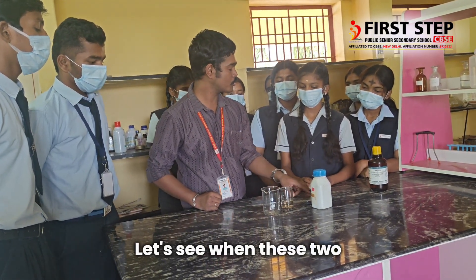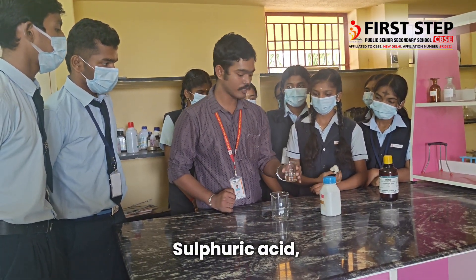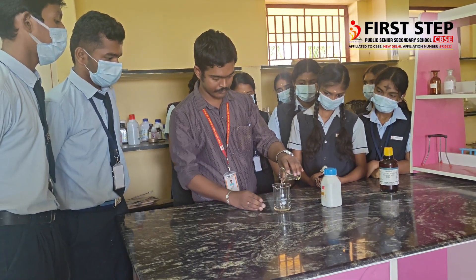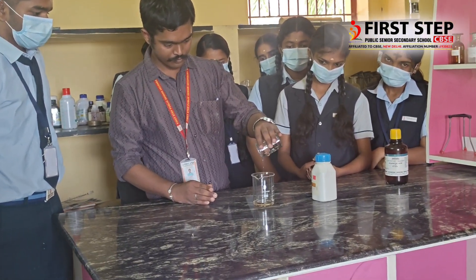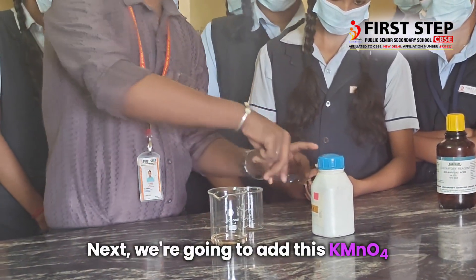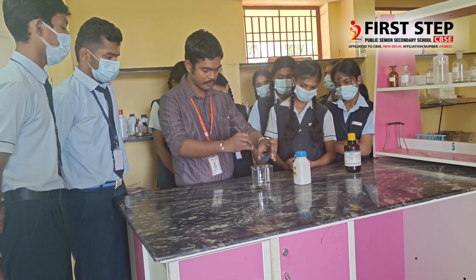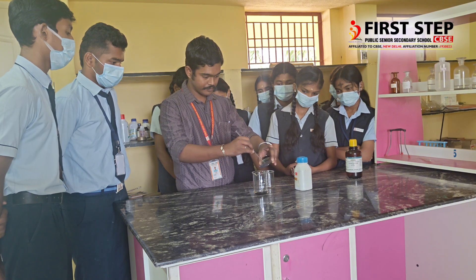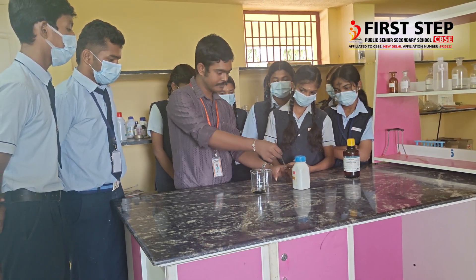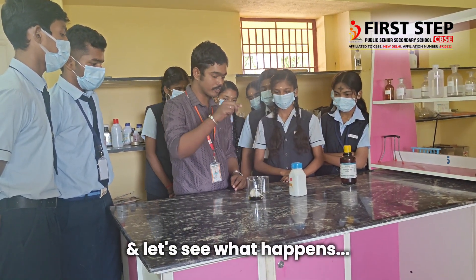Let's see what these two reagents together produce. This is concentrated sulfuric acid. We are going to add concentrated sulfuric acid. Next, we are going to add a portion of KMnO₄ powder into this liquid acid. Now I am going to dip this cotton in this liquid. Let's see what we have.